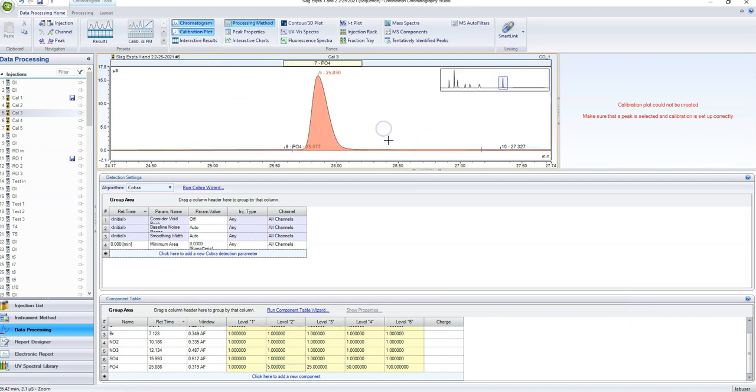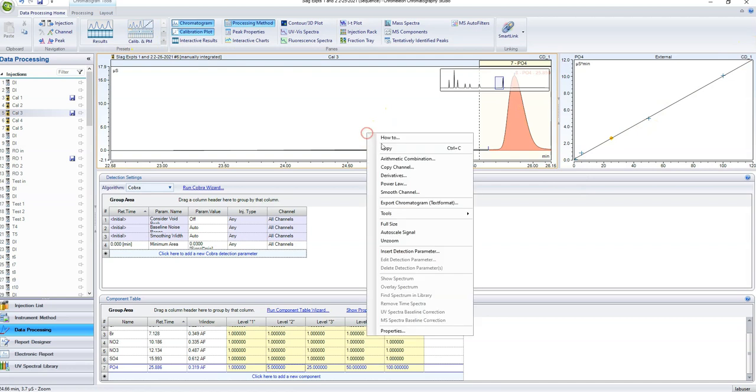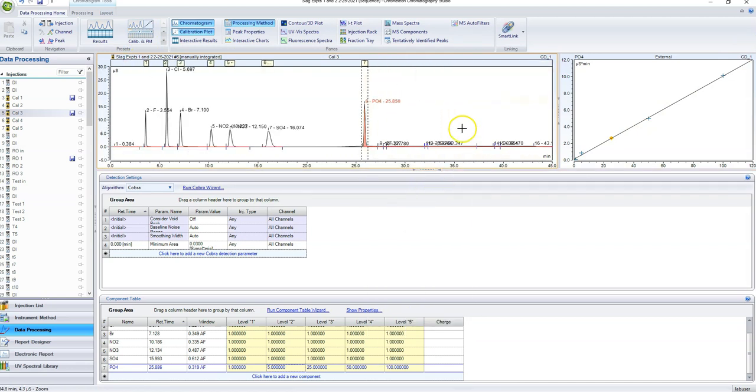Calibration point 3 was not recognized as phosphate. So for some reason it thinks that this tiny thing is the peak. So let's delete that peak. Now it thinks it's phosphate. And now my phosphate calibration plot is linear. That's actually kind of good that that happened. It surprised me, caught me off guard. But now you can see that your calibration plot is straight. I thought I made my calibration curve wrong for a second.